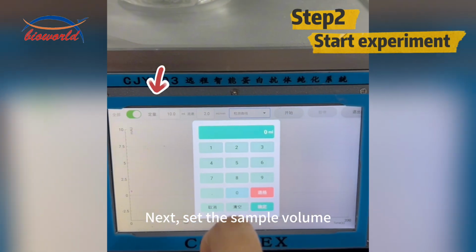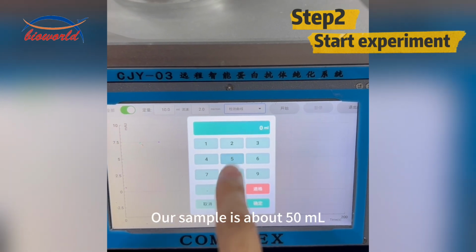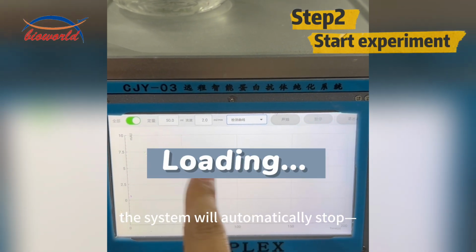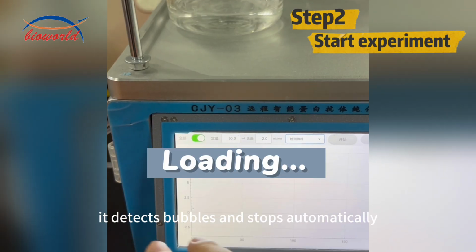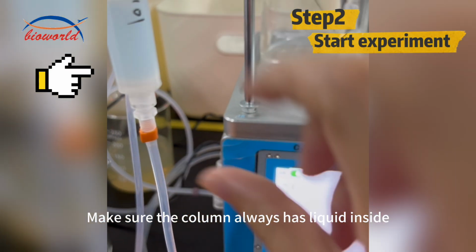Next, set the sample volume. Our sample is about 50 milliliters. After loading is complete, the system will automatically stop. It detects bubbles and stops automatically. Make sure the column always has liquid inside.